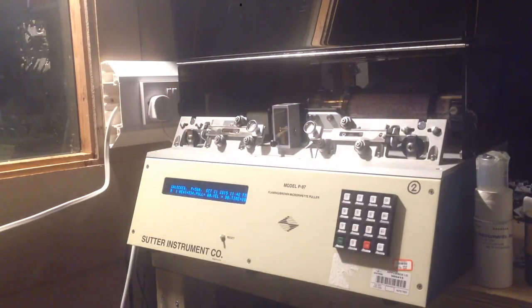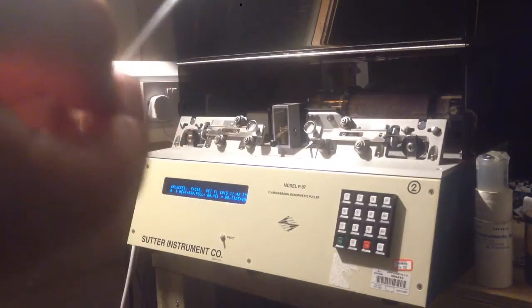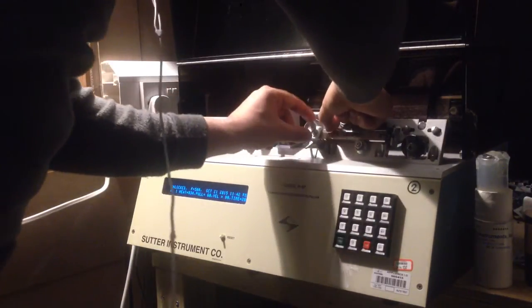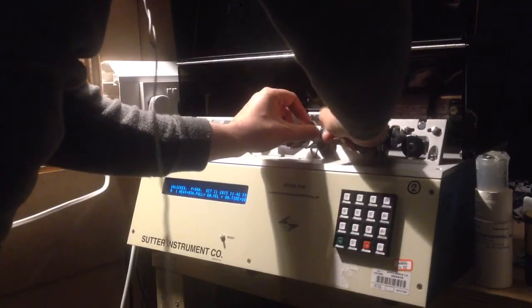I have no idea what the feature sizes are, but they looked good to me under the microscope and I'll link some microscope images below. The tip is a micron-scale feature size, so under my inspection microscope at around 50x magnification there's no way I'll really see the tip. To actually verify if these have worked is the next step — I'm thinking I can look at ionic currents through them, since I have my own self-built trans-impedance amplifiers and a patch clamping rig and the buffer solution to do that.